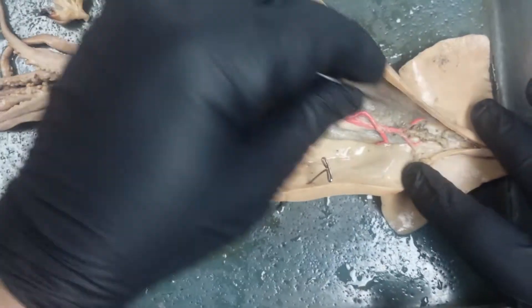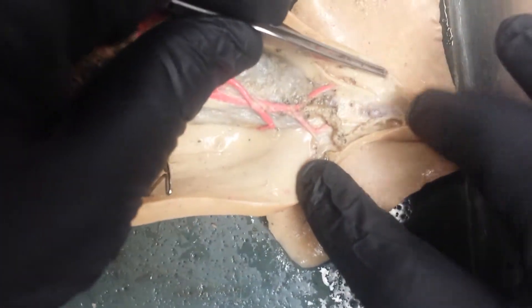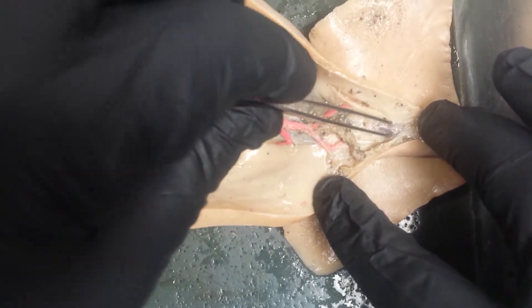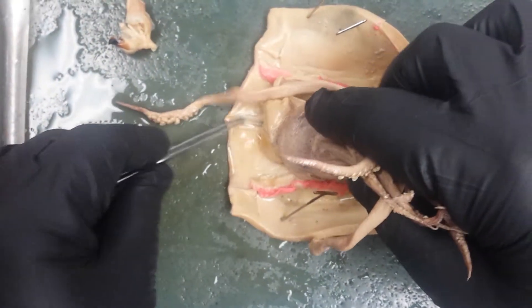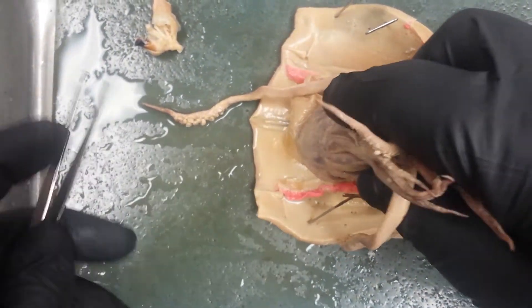If we look just up here and underneath, we find a remnant — there's a piece of the pen right here. There's the pen there as well, and it runs the whole length of the animal.